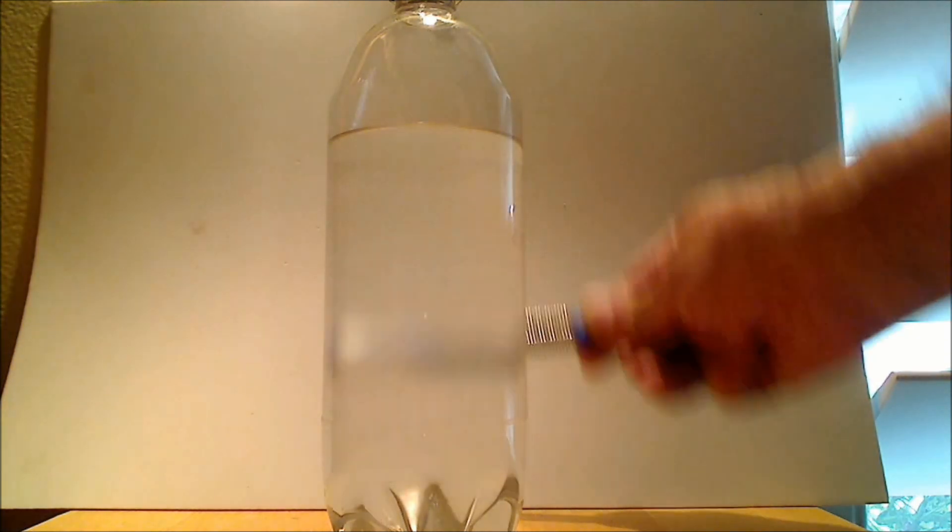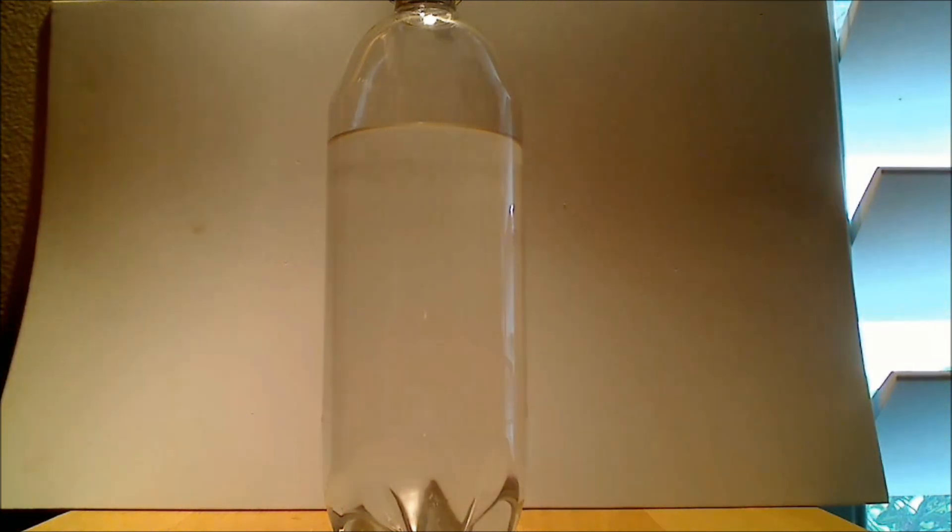Put something behind it, you can see that it's very turbid. But now it's starting to clear up. It takes a little time to be patient.